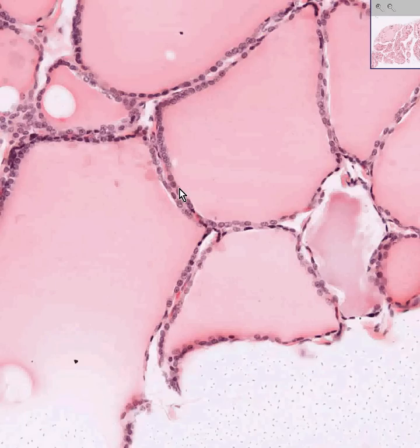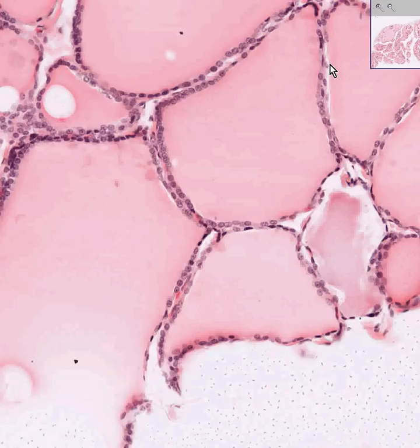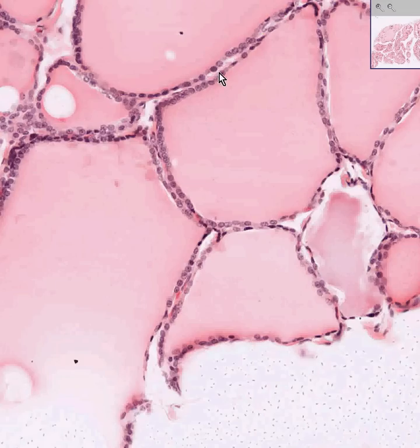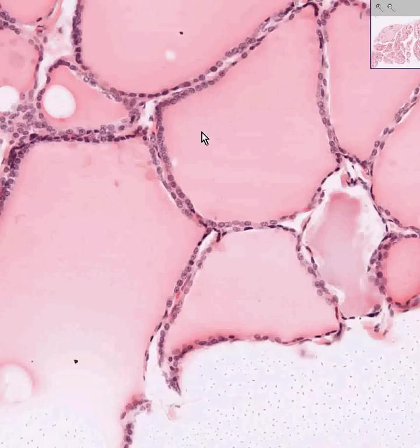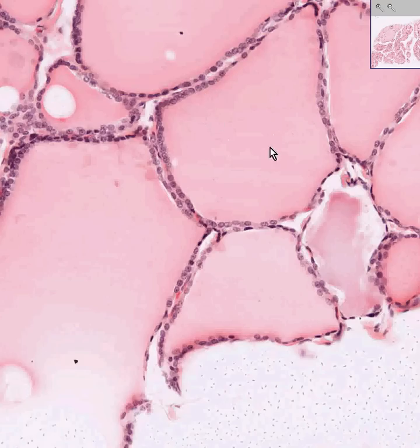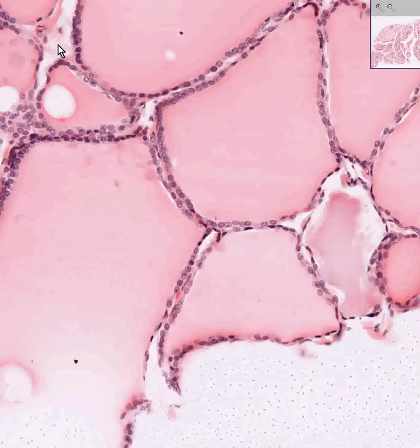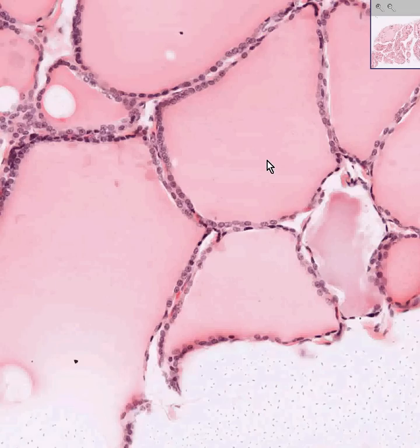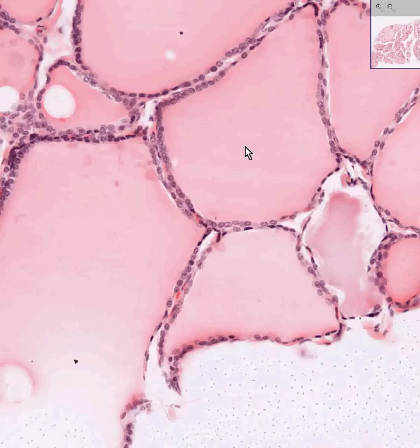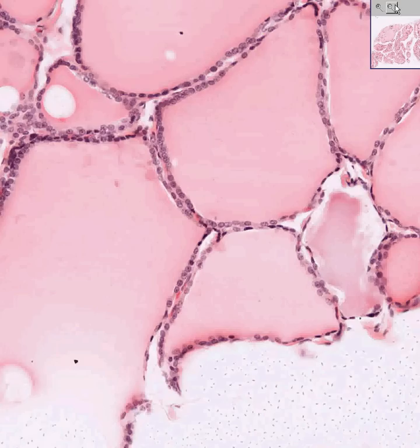That's it for the thyroid, but there's one other extremely important thing I want to show you. These are the cells that create the thyroid hormone through the complex technique of entrapping iodine and substances, then pouring out the storage form of the hormone which is stored inside the follicle. But don't forget to look in this connective tissue between the follicles, because the thyroid makes two hormones. Besides making thyroid hormone — the active form being T3 and T4 — it also makes another hormone called thyrocalcitonin.